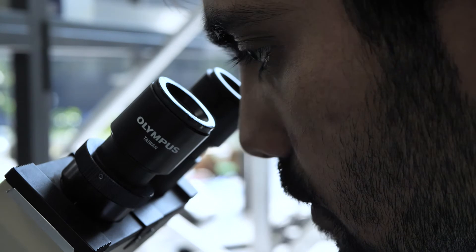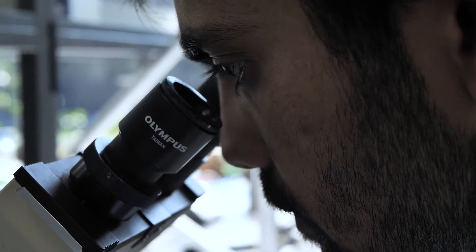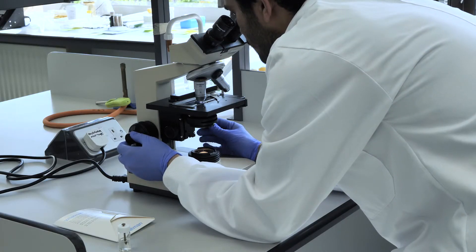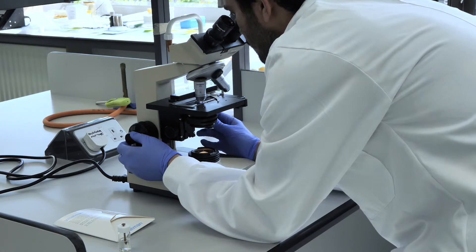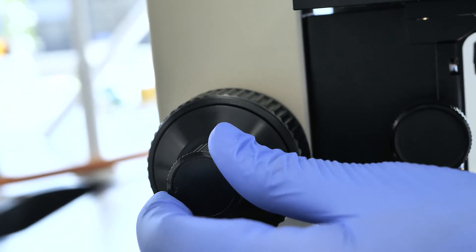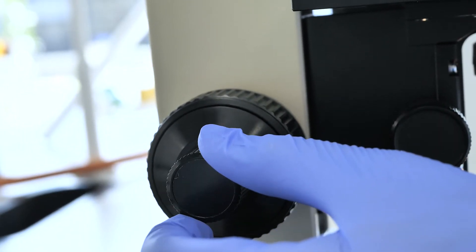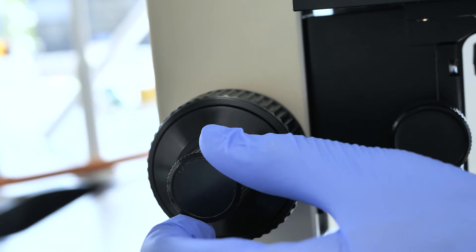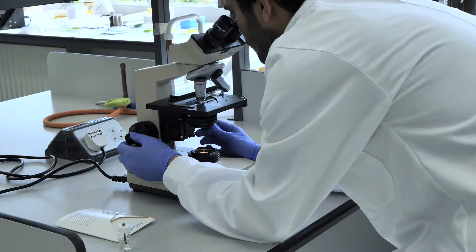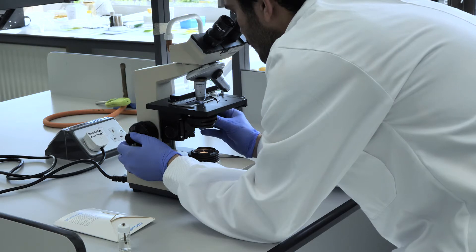While looking into the eyepiece, carefully use the fine focus wheel such that the slide is moving away from the lens at all times, and look for the field to come into focus.